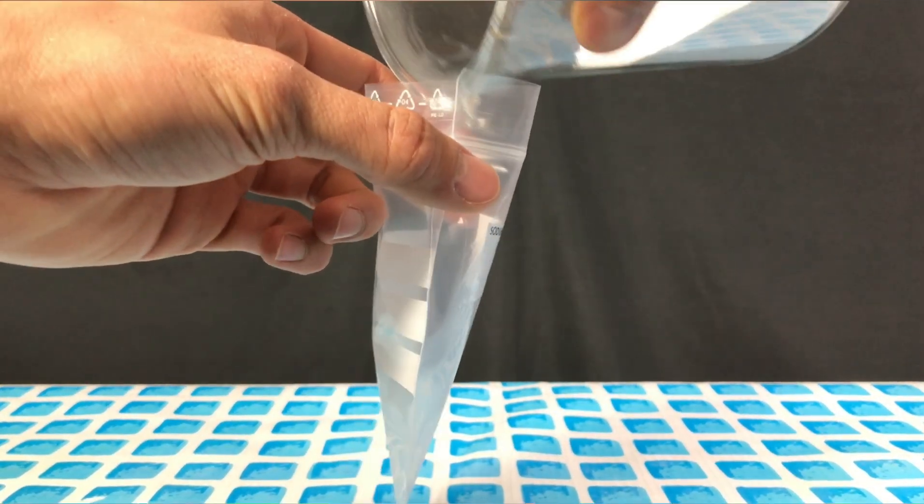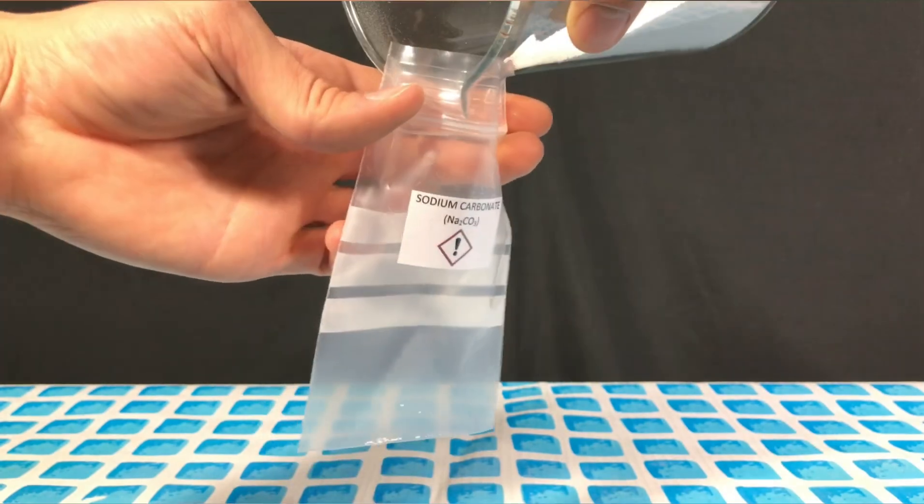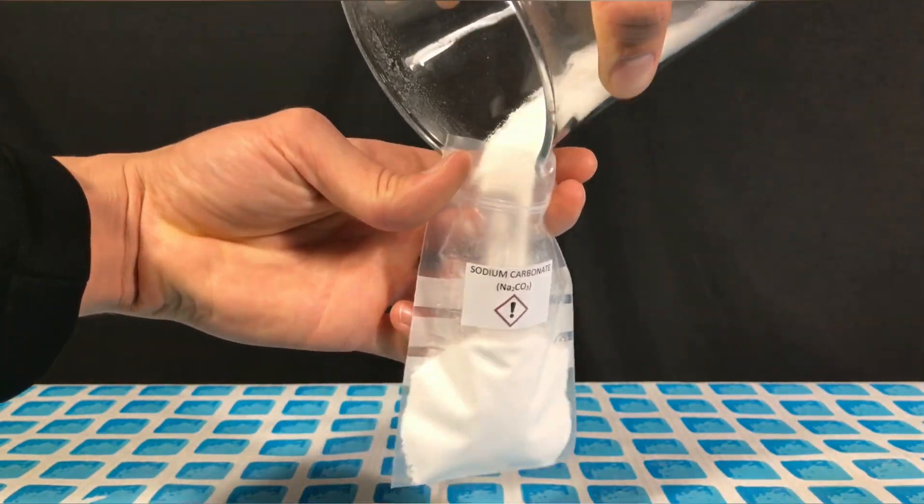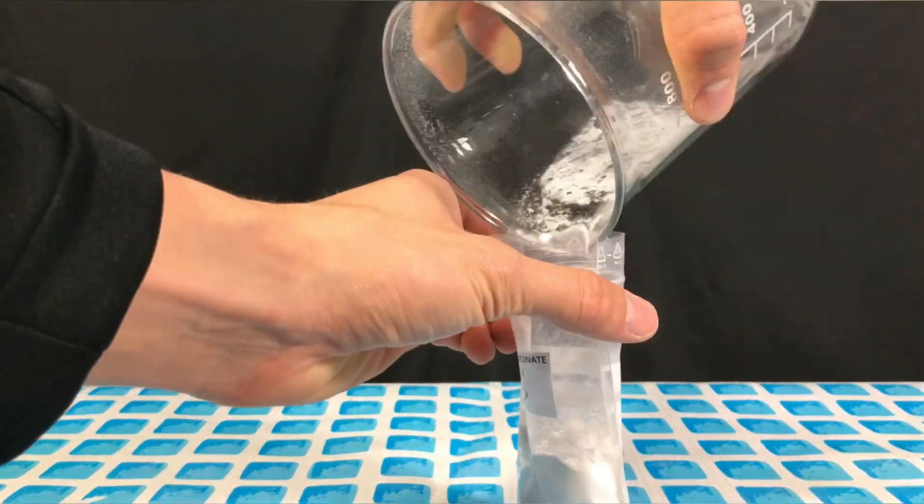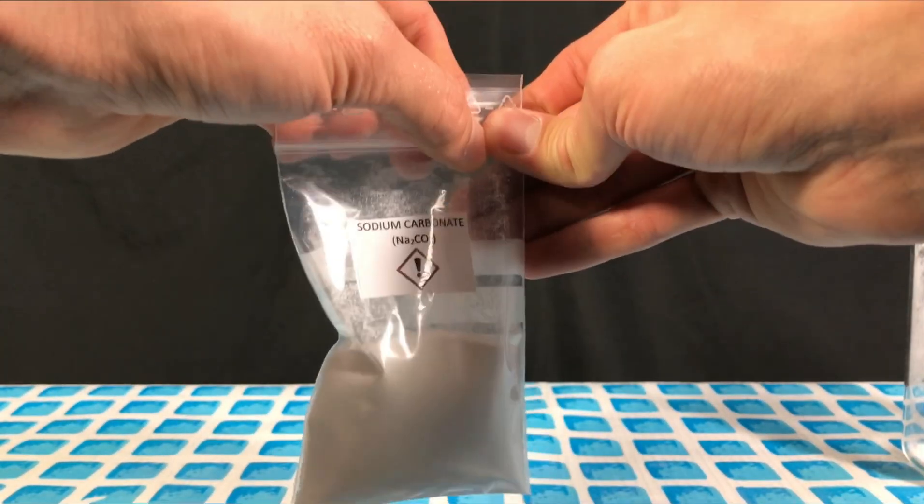The sodium carbonate was then transferred to a storage bag and put away. And there you have it, sodium carbonate.